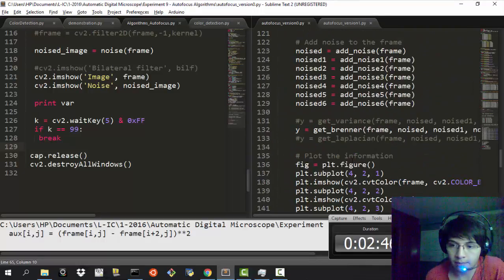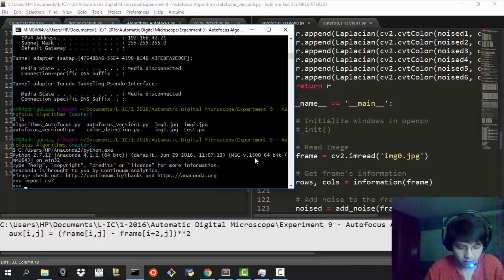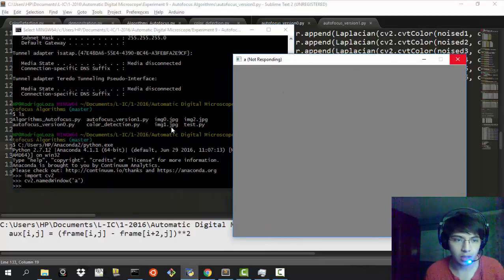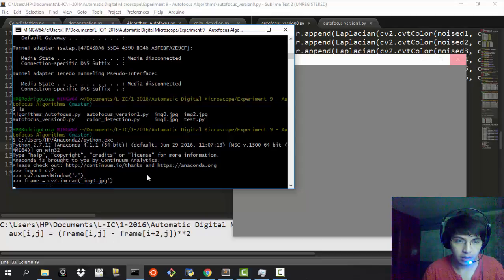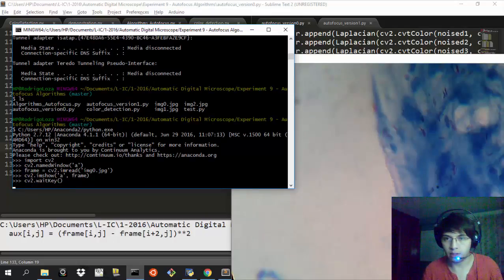I have written a very simple program in Python to show you this. I just prepared this, and I'm going to show you the image that we're going to see. So we do frame equals cv2.imread, reading image 0.jpg, and cv2.imshow in the window, and we put the frame. Then we just do waitKey, and this is the image that we're going to see.